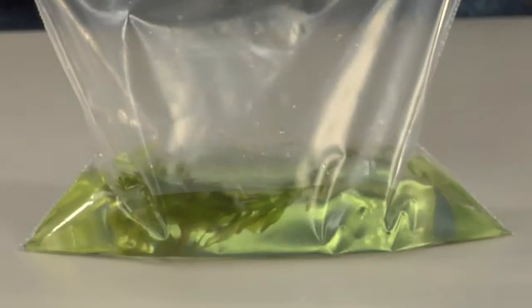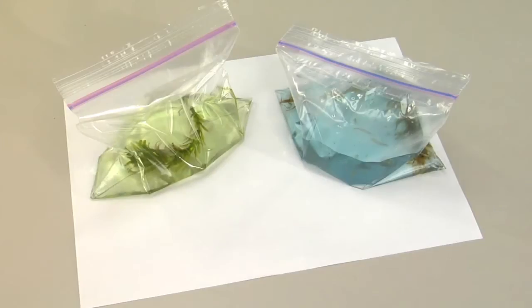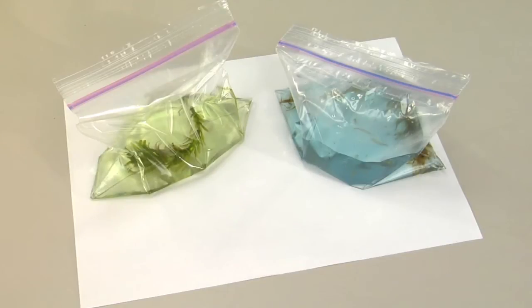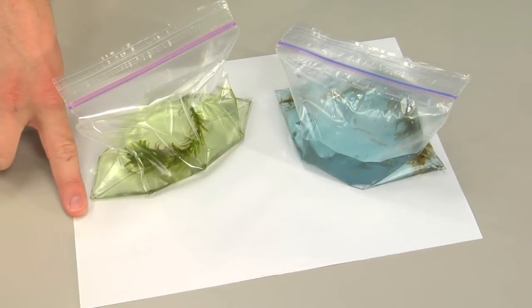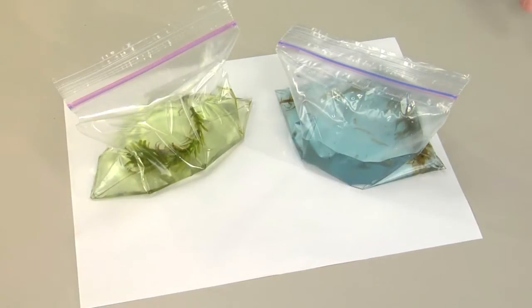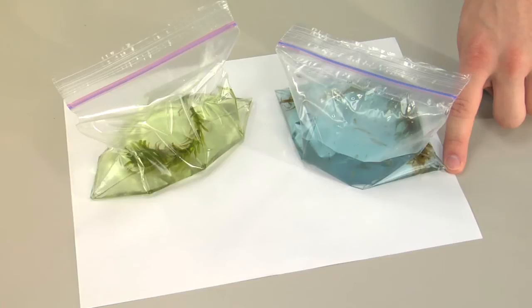Set the experiment aside for later observation. After a couple of days, repeat the exercise and compare the two baggies with your class. Students will notice how the water in the most recent test remains green from adding carbon dioxide, whereas in the previous test, the water turned blue over time due to photosynthesis.